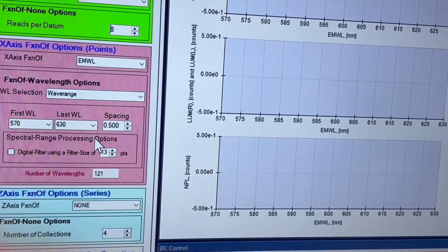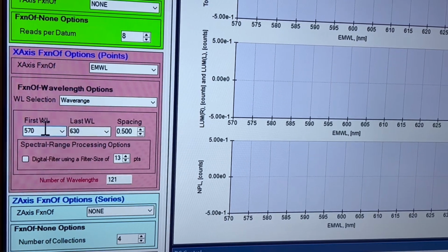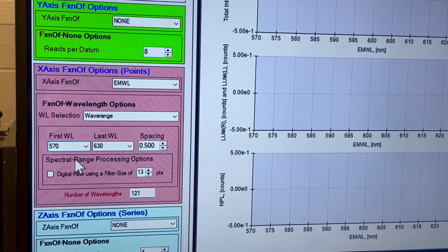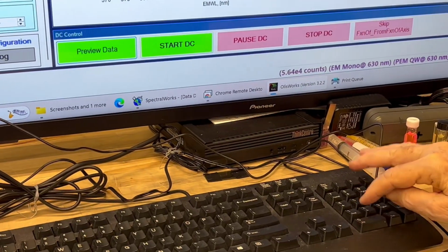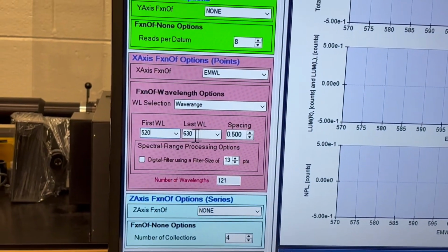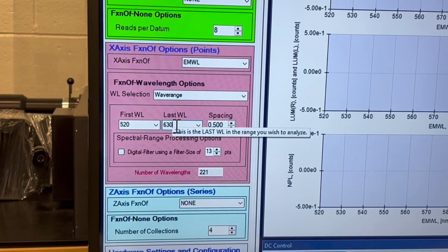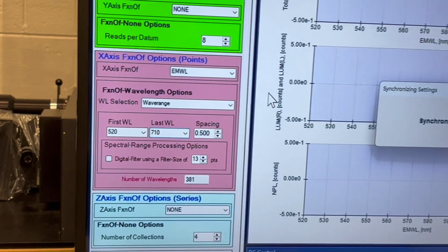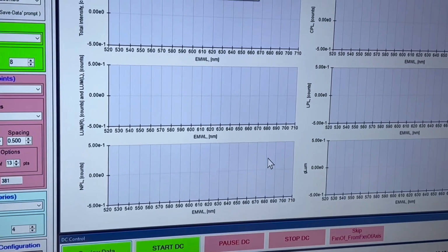And how do you change that? You've got a drop-down arrow? No, I just click here. Yeah, there we go. I click there, and I'll make it 520. And then I can click here, and what I often do is to go to 710. Good.